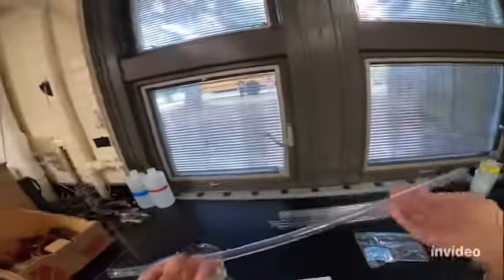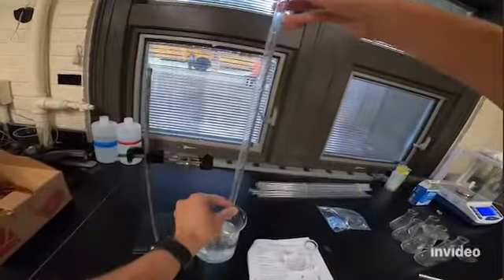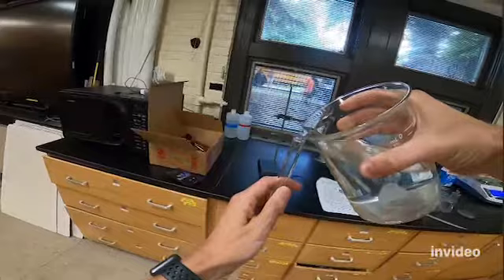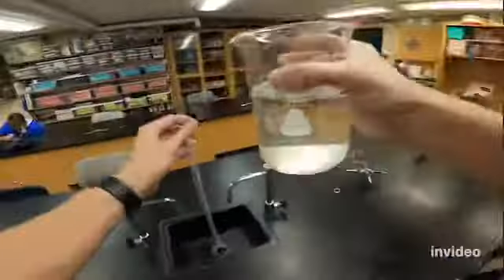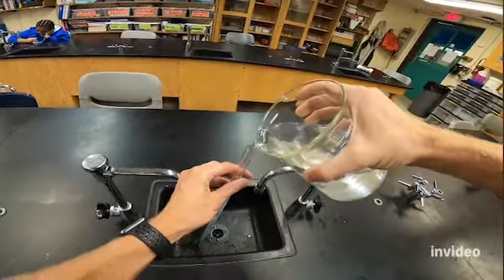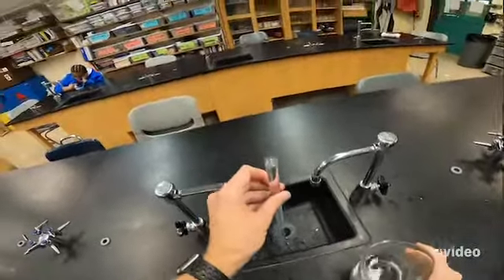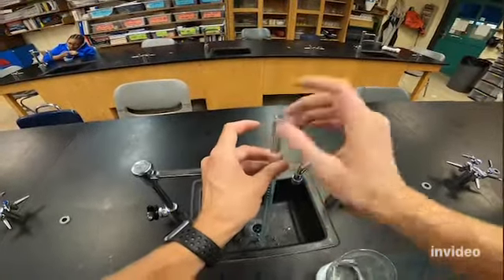And then next I'm going to get one of these glass tubes. This is called a eudiometer. And the way it works is it actually works upside down, and you fill it with water. So I'm going to take my beaker and I'm going to carefully fill the eudiometer, and I would actually probably recommend that you guys do this over a sink just in case. So we want to fill it all the way so that it overflows.